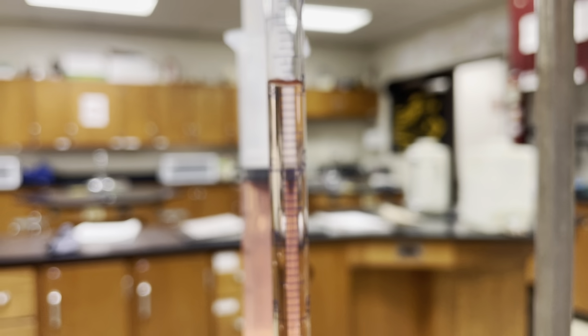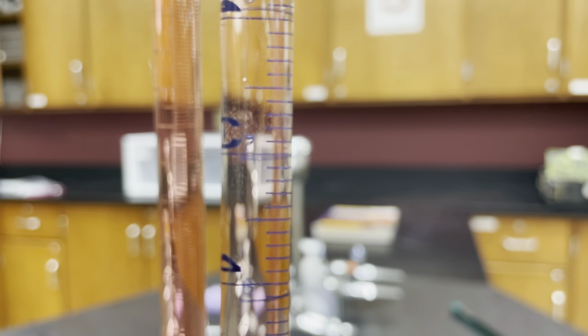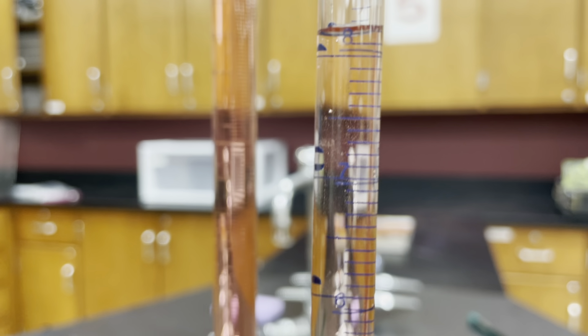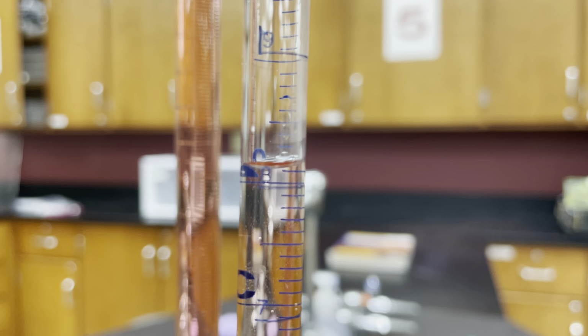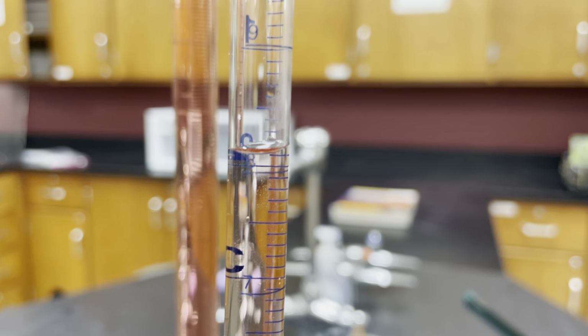Now these little lines that you might be seeing are actually just on the other side. These are counting downwards, whereas these are counting upwards. Now even though it kind of looks like these tens lines are lined up with this, it's hard to say whether we can use those or not, since they're on the other side of the glass. So depending on how you are on eye level, it might not be the best way to measure this out.